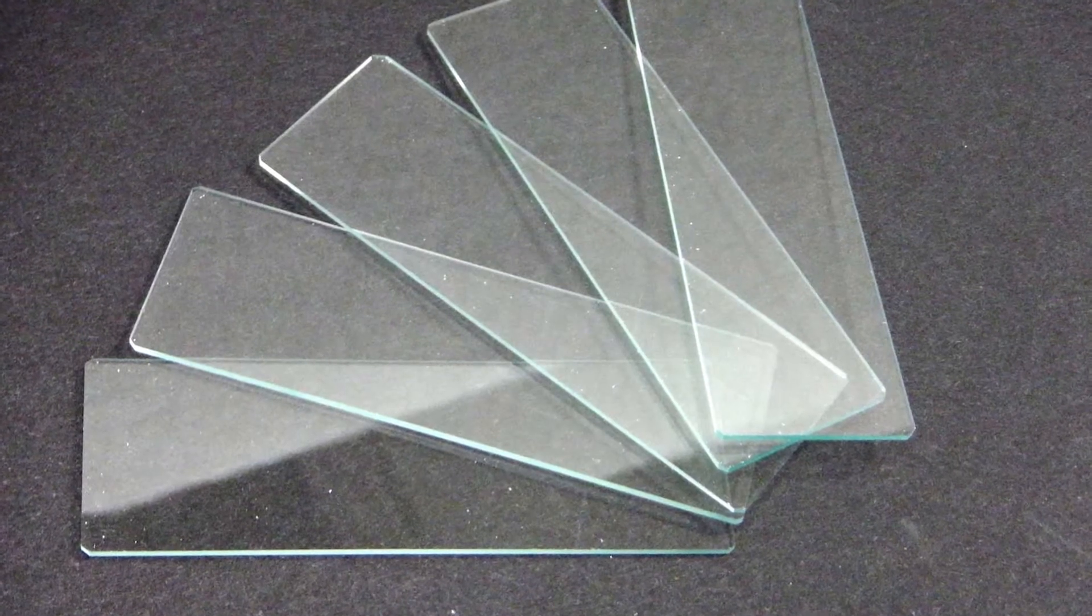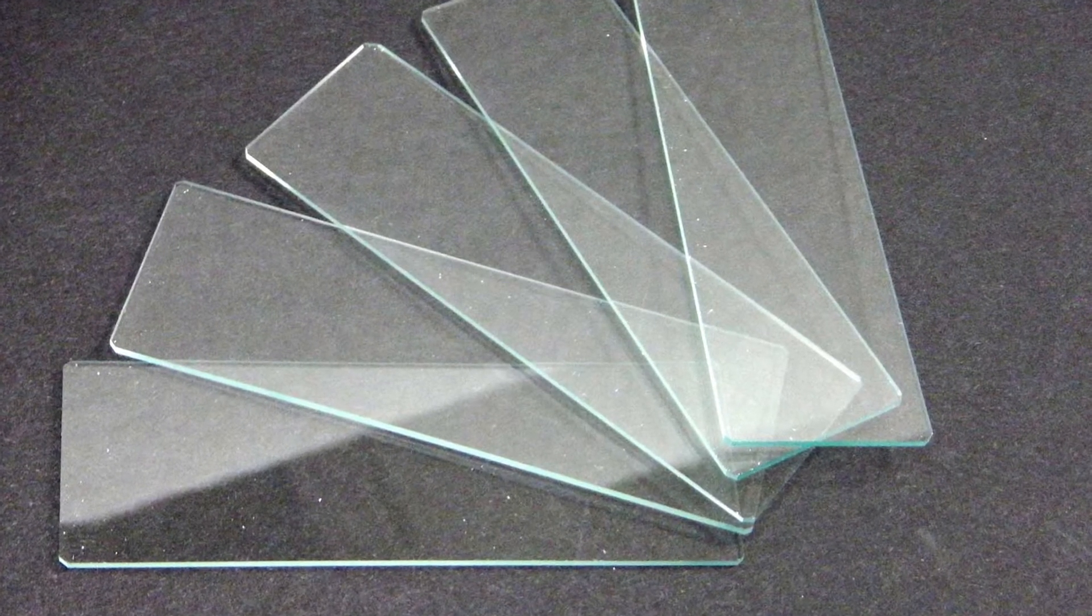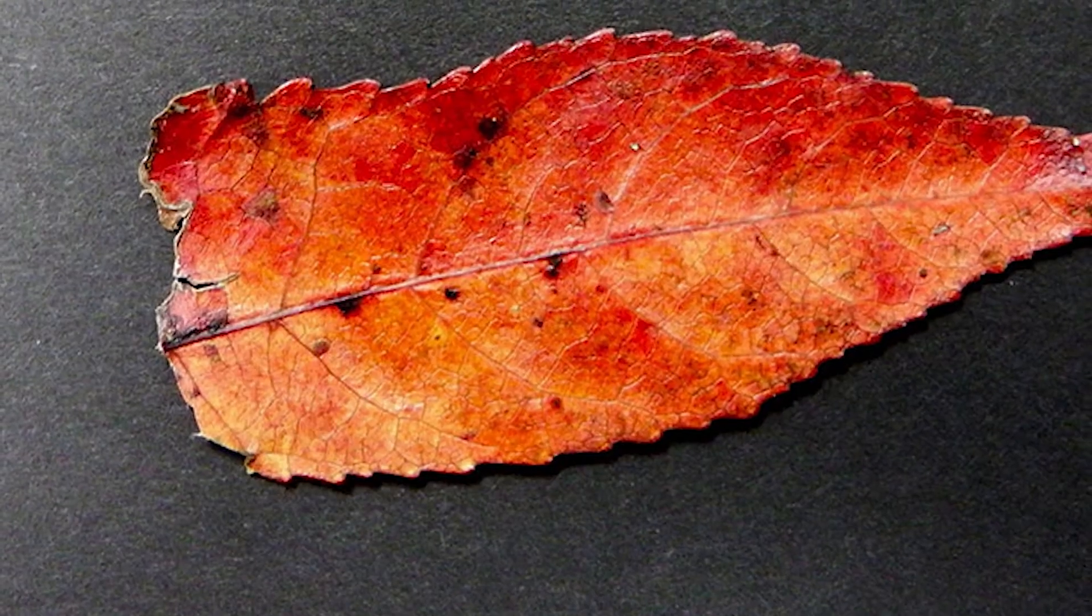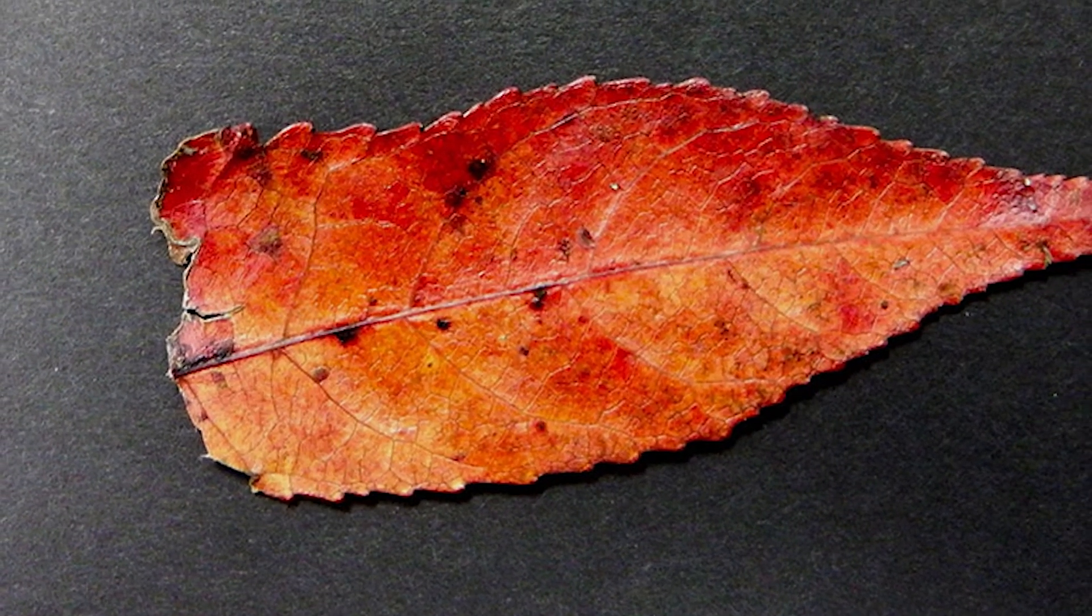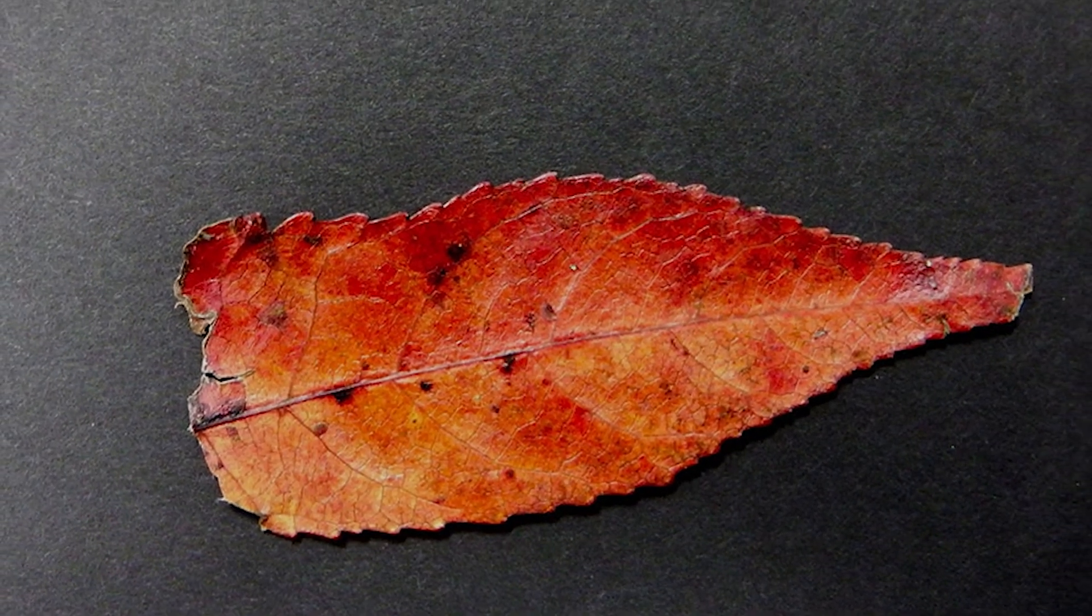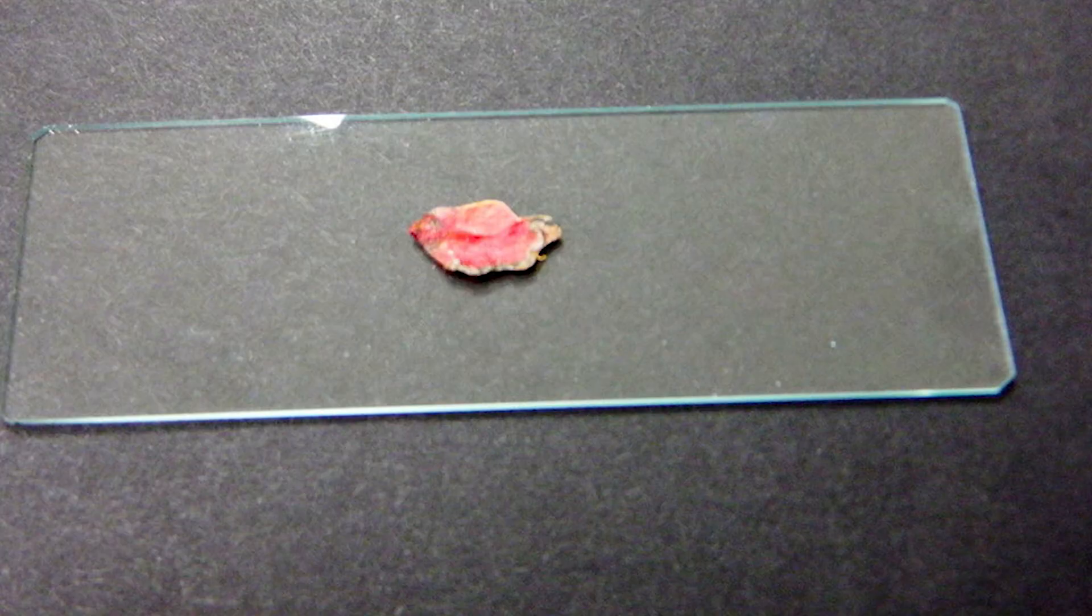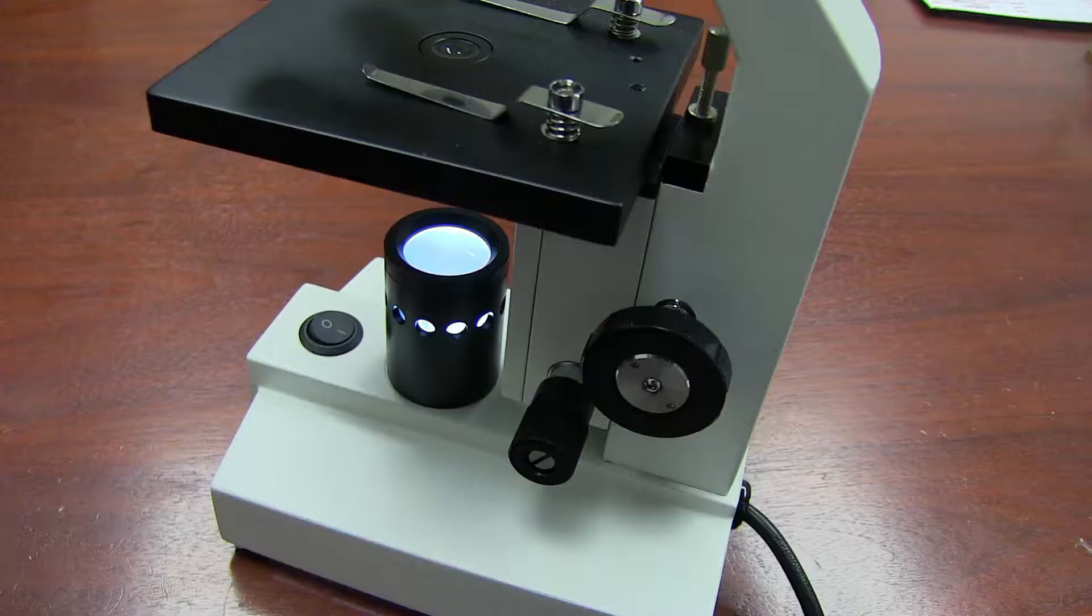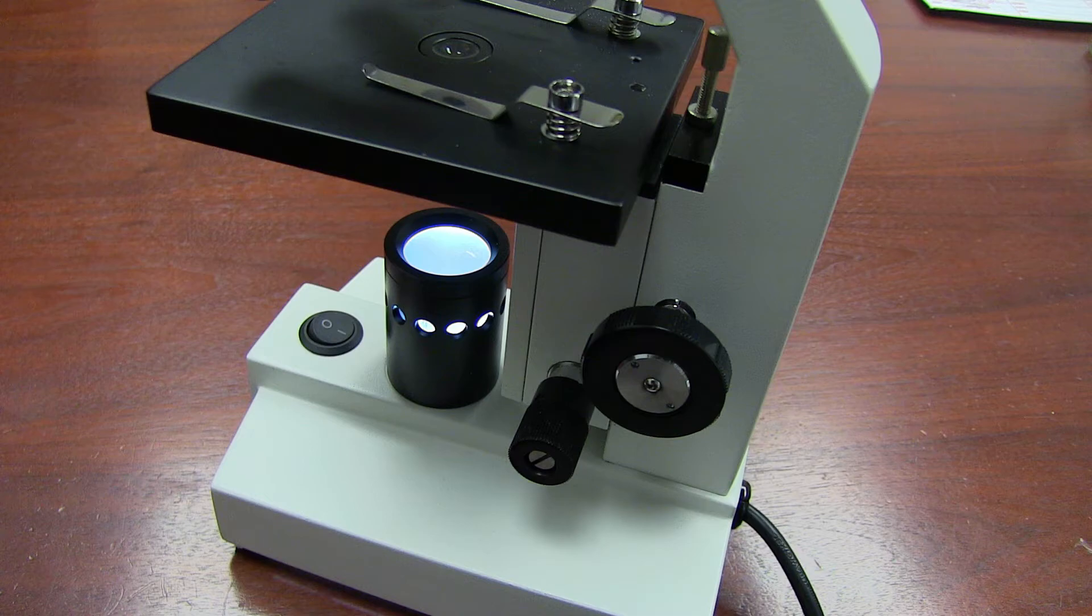Slides are small slips of glass or plastic. They are delicate and easily broken, especially glass slides. To see anything smaller than we can see with our eyes, or to see microscopic details on visible objects, we apply these items to a slide and place them between the illuminator and the lenses so that we can take a closer look.